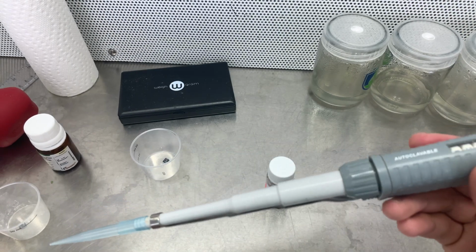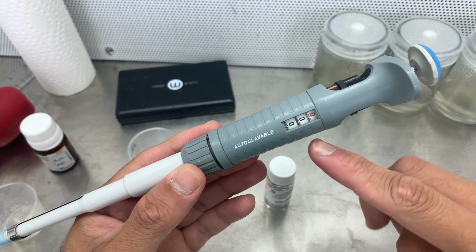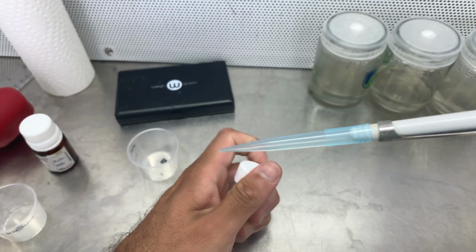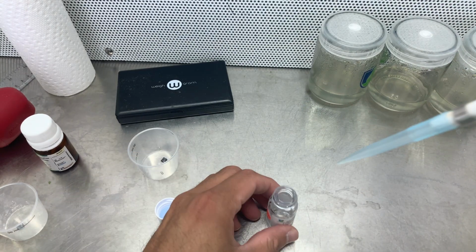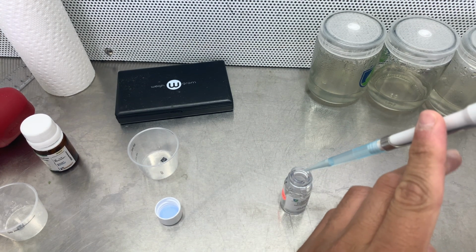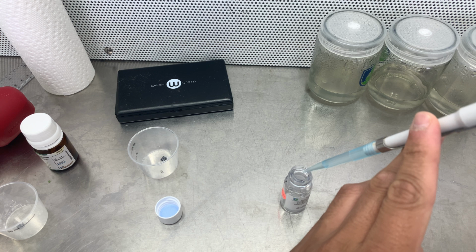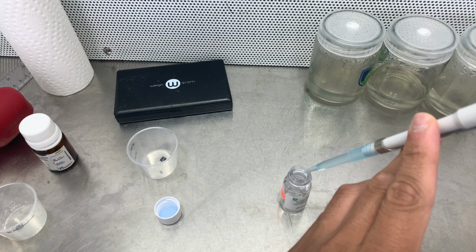All right, so this is me from the future using a much better pipette. This is a way more expensive professional pipette, and I should have used this. This is the same amount, 0.3 milliliters per liter, just to count the drops using a bigger tip. This is a 1000 microliter pipette. So let's just count some drops and see what happens. 1, 2, 3, 4, 5, 6, 7, 8, 9, 10, 11, 12, 13, 14, and 15.